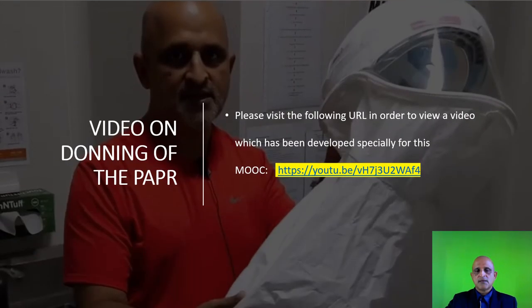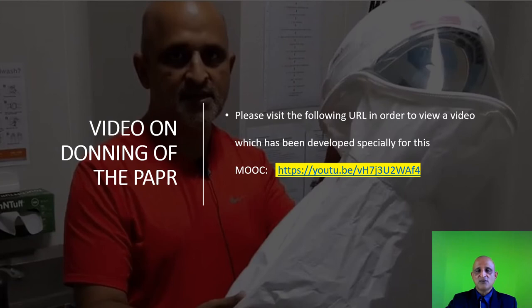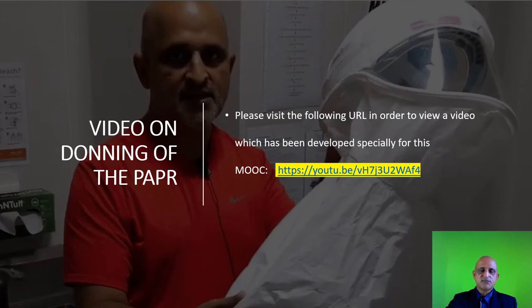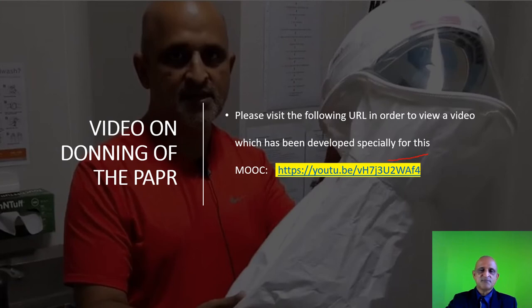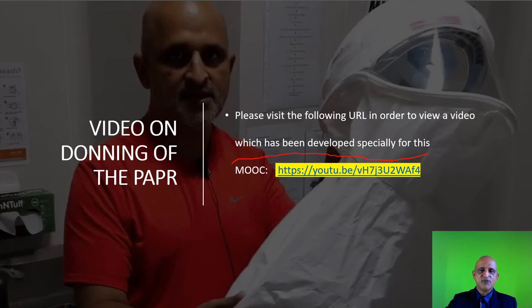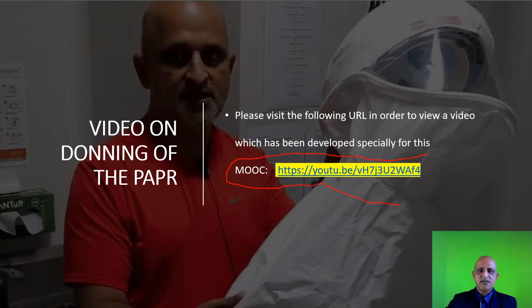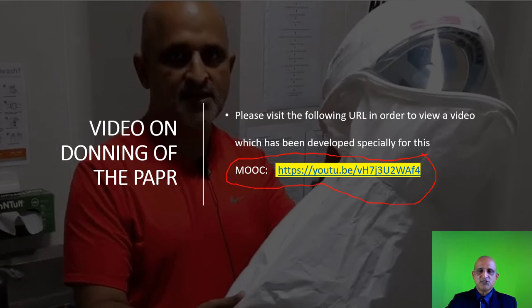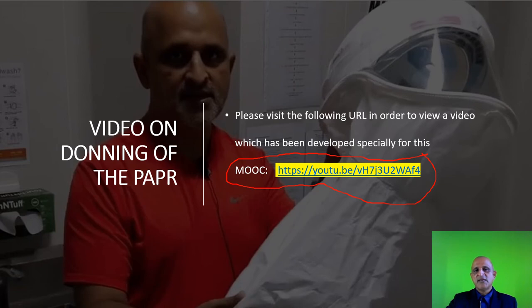A video on the usage of the respirator can be accessed from this particular link. I have prepared a tutorial on the usage of the PAPR.